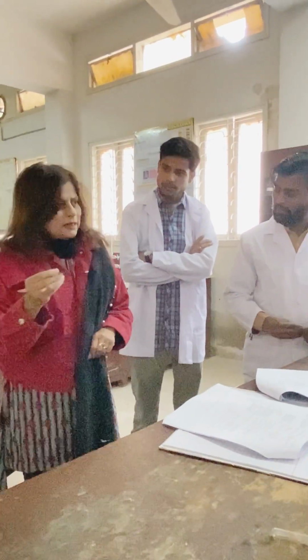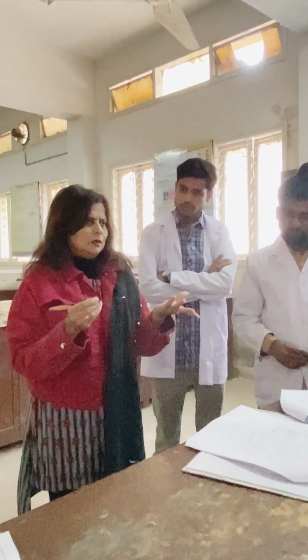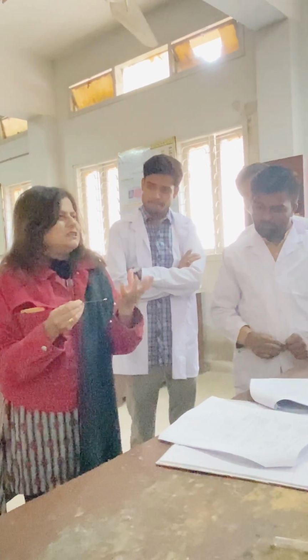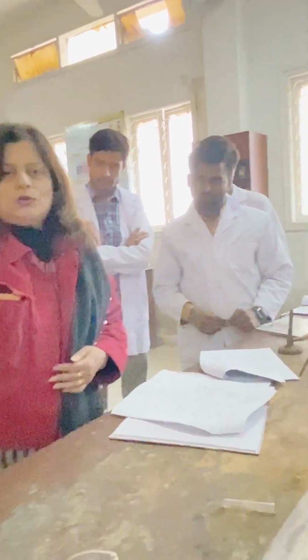So the color of soot, it is going to give you black. Black means soot. Why do we call it? Because a lot of carbons are there in your compound. So when they get burned, they give you the black color, right? This is why it's happening. Okay, so this is the scheme. This is how you are going to perform the ignition test.